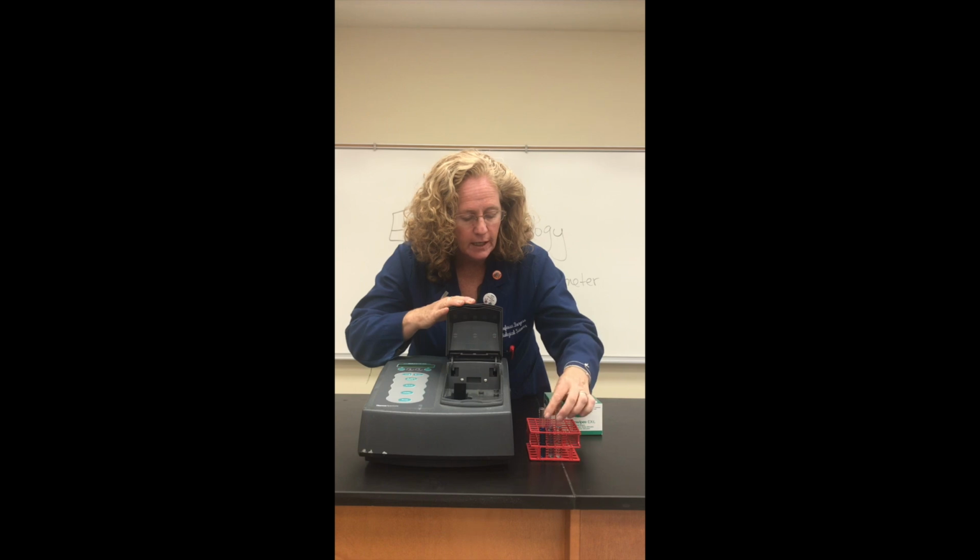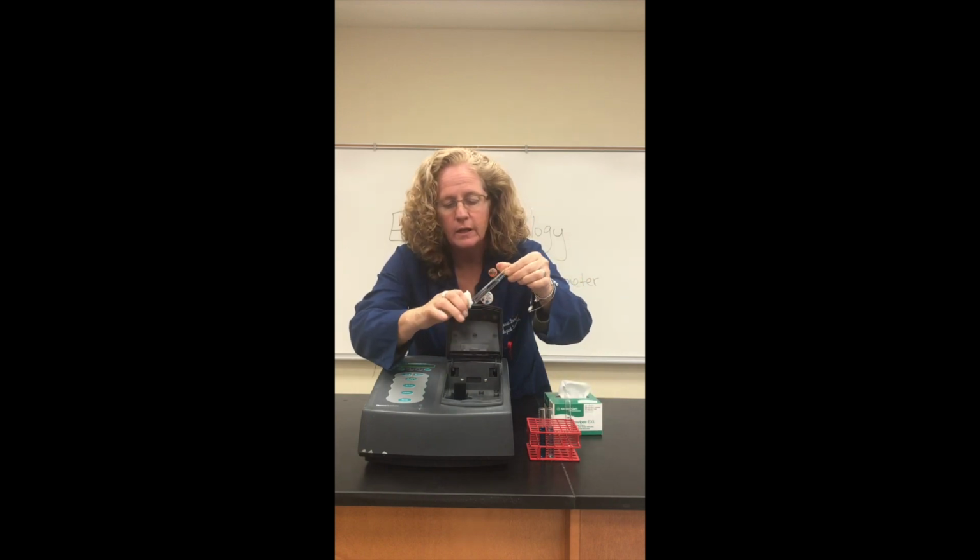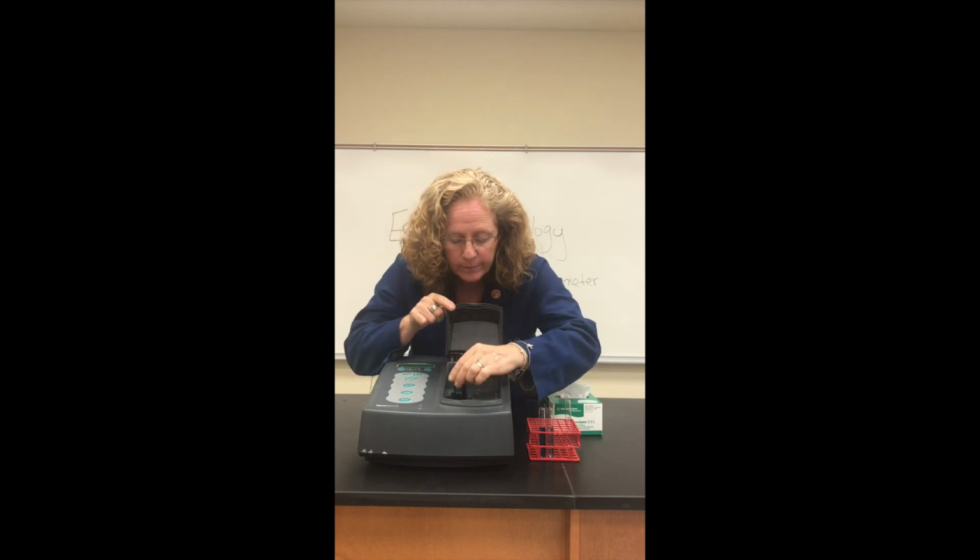Take this one out, and then we're going to, of course, do our last one. On the last one, we wipe it down, put the tube in, close the door. This one has a reading of 0.007.